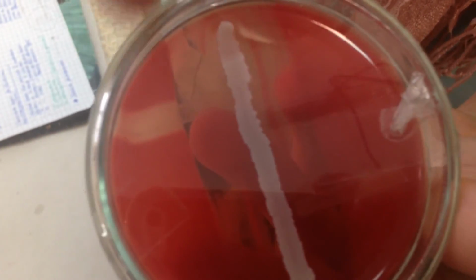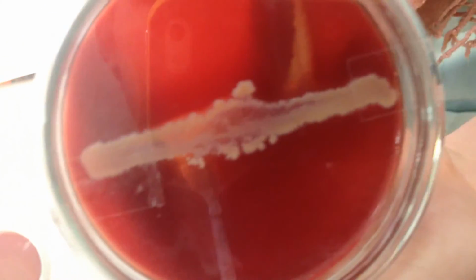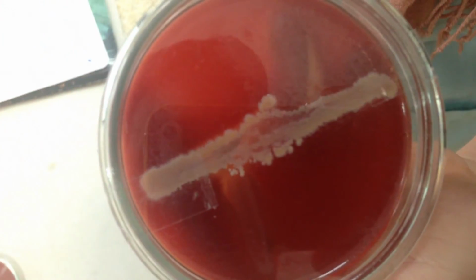Then we have the CAMP test, which is for Streptococcus pyogenes and Streptococcus agalactiae. It is positive for agalactiae if there is an arrow forming. In this case, it's actually not. None of them. There is another CAMP test, but look for the arrow. If it's an arrow, it's positive. If not, then not. So you wouldn't consider this an arrow? No.